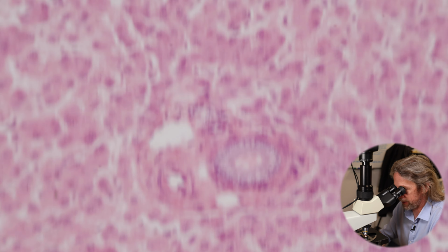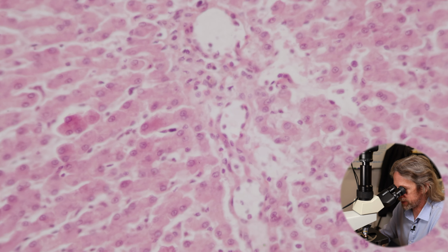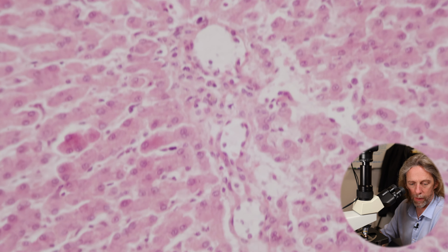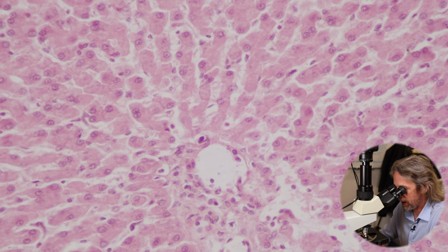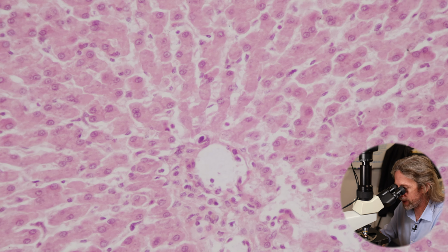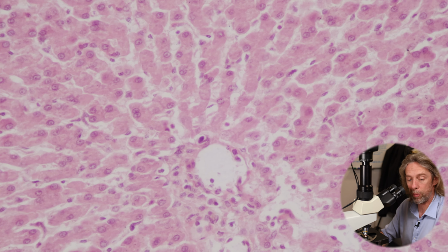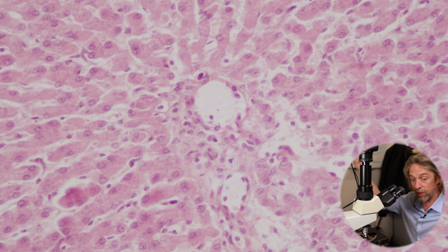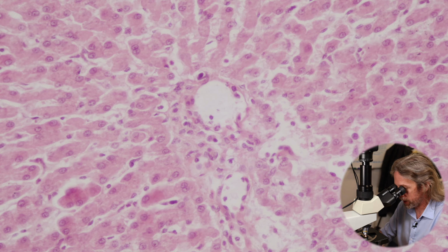That's your portal triad. And then if you compare that to a central vein, here we've got lots of circles, but they don't look like that portal triad. We haven't got a tube lined by a simple epithelium. It just looks like a very thin-walled vessel lined with very flat cells, and those are the endothelial cells. So that's a low pressure vein, a hepatic venule that's going to drain to the hepatic veins. And the other thing we can see is the sinusoids leading towards it. If you're starting to get the shape of the flow, brilliant.